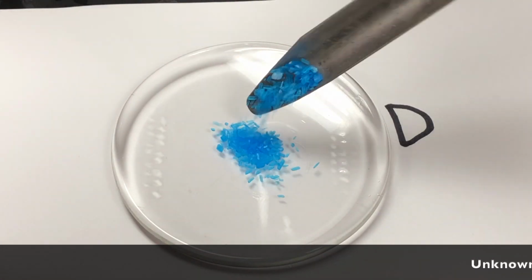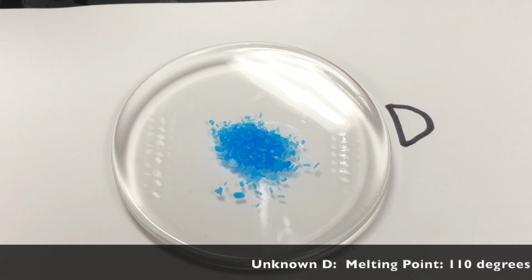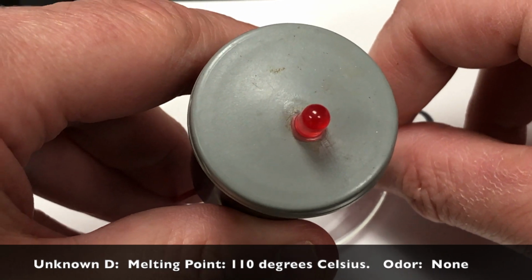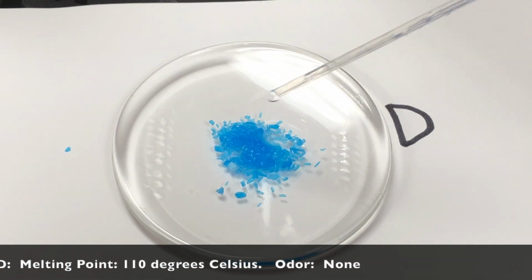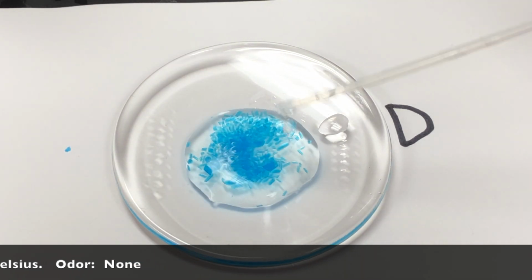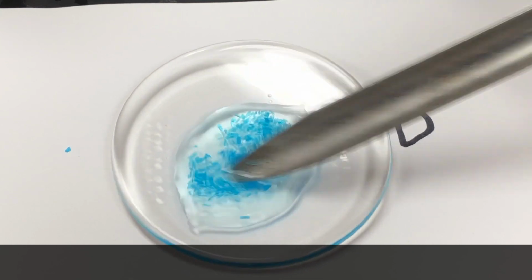Unknown D is unusual compared to the previous solids that we tested. As you can see, this is a blue solid this time, and that's why we have it on a white background, so you can make your observations more easily. I'm not going to make any more commentary about what you see here in terms of the results. For the remaining solids and other substances, I want you to try to do the same thing.